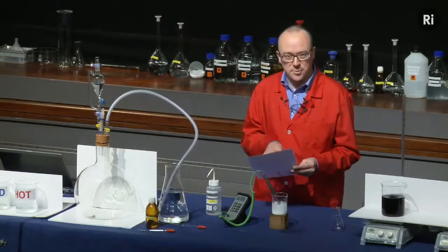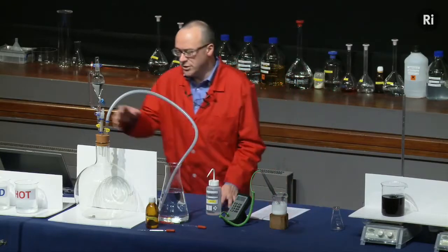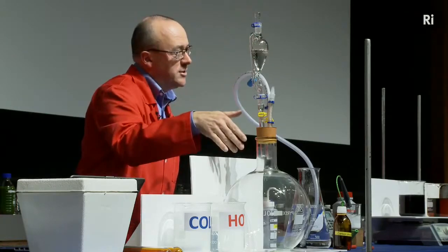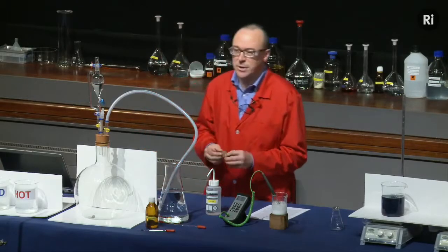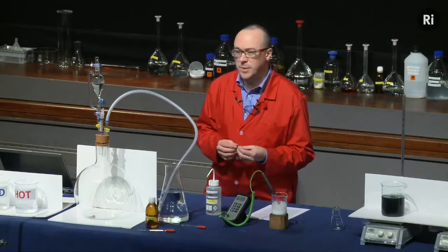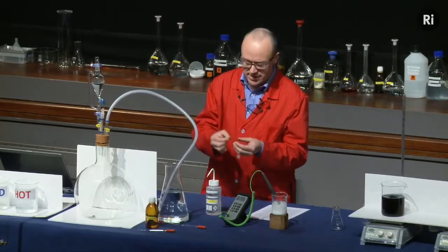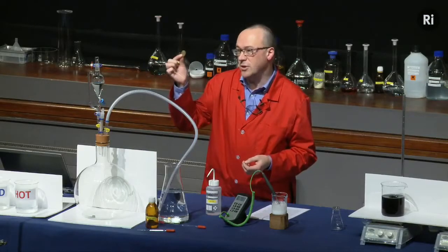And so when we get to the appropriate point in the story, I'm actually going to show you the reaction. And the reaction is going to happen in this flask. In this cylinder at the top, we have some nitric acid, and in the flask, we have copper. Now, the copper, for reasons you'll see in a moment, is in the form of a coin. Now, we can't use a modern penny or two-penny piece because they're actually made of steel with just a thin coating of copper. So I've got an old-fashioned penny here. This was made in 1945. So this is actually made of solid copper.